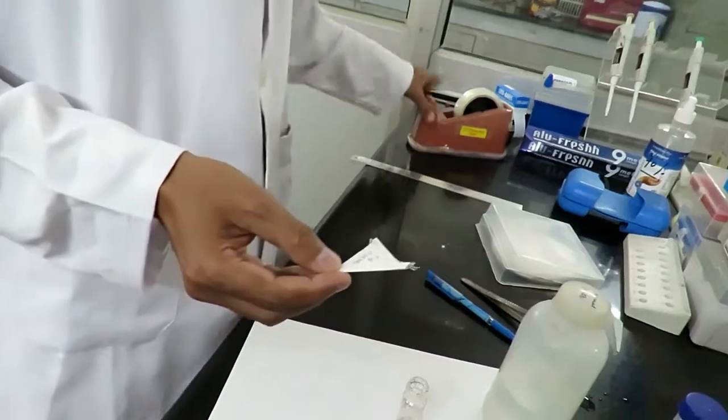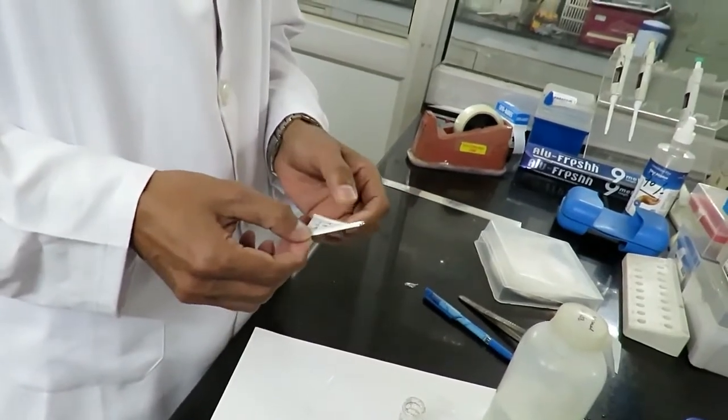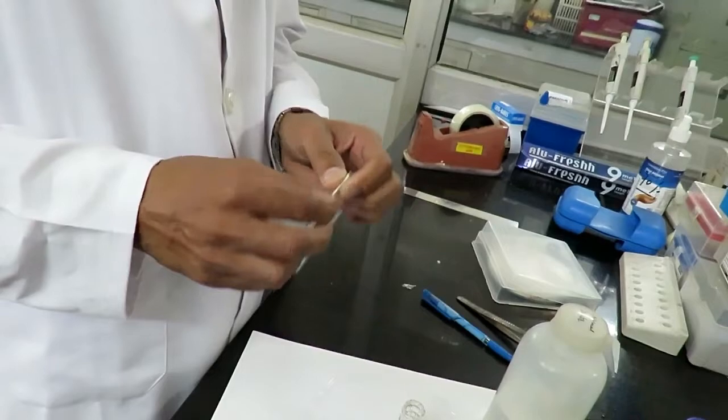And all these sealed packets we can keep at room temperature or we can put them in an incubator.